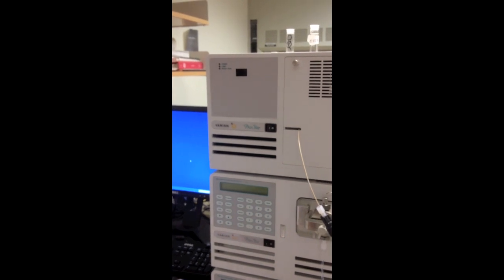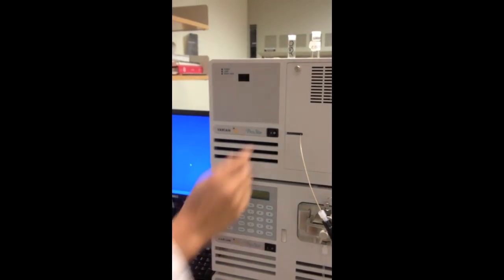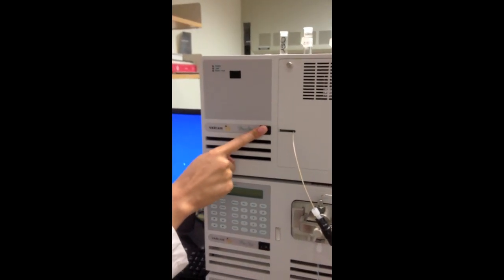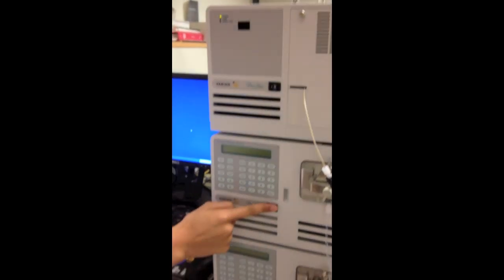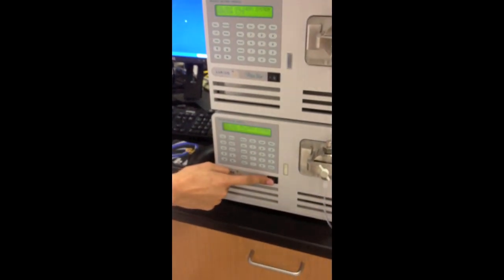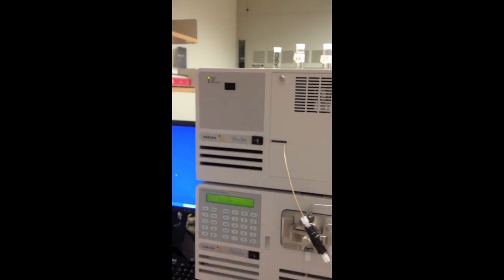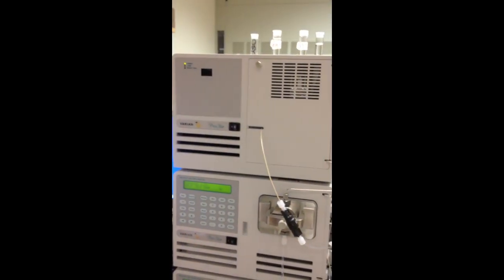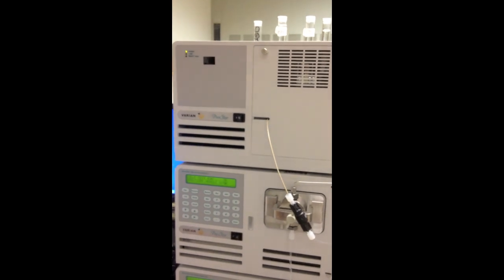We are going to turn on the HPLC machine. So first, you turn on the detector, first pump, second pump. And as it's getting warmed up, you're going to hear a couple funky noises. It's just warming up right now.